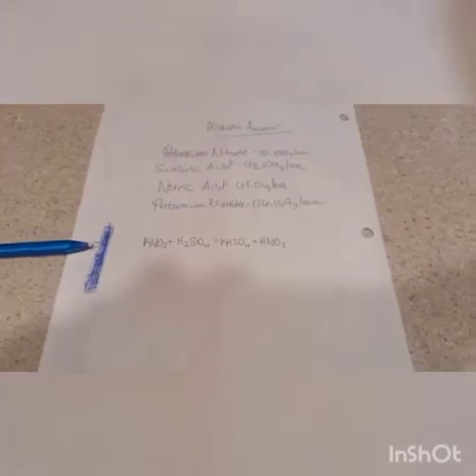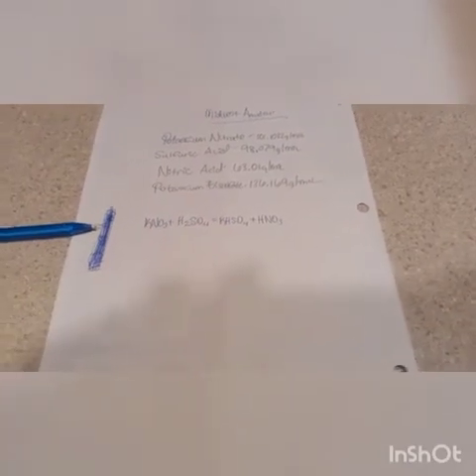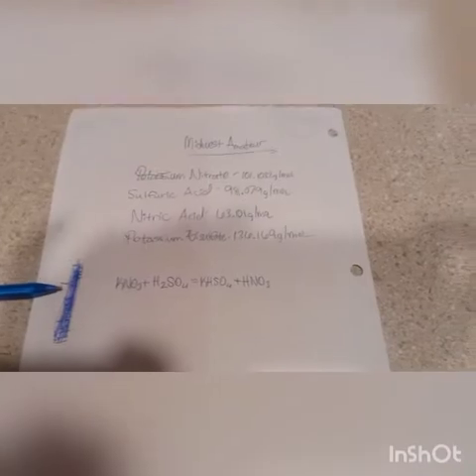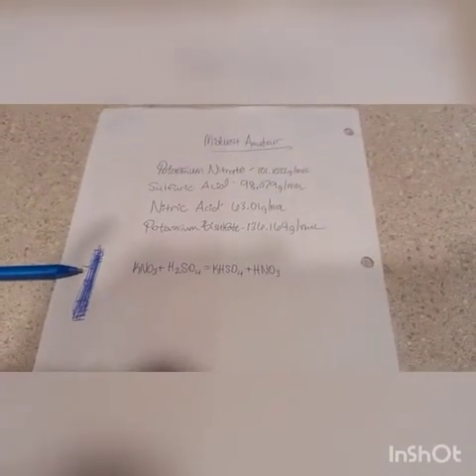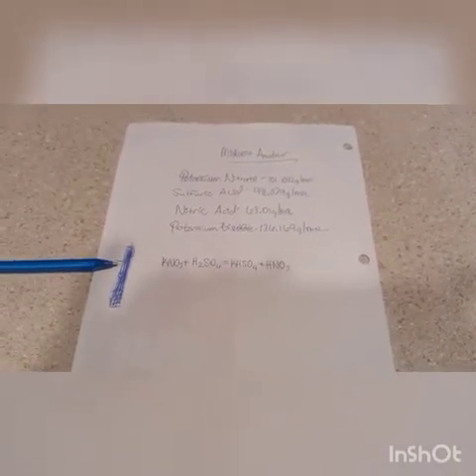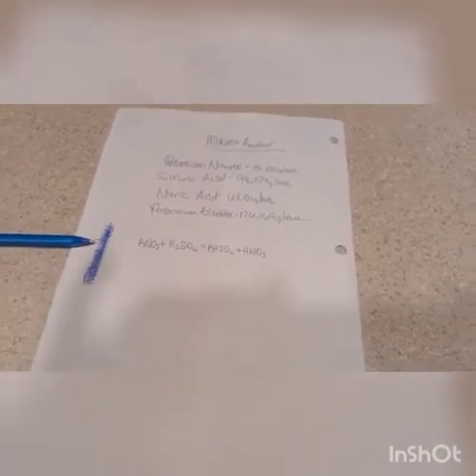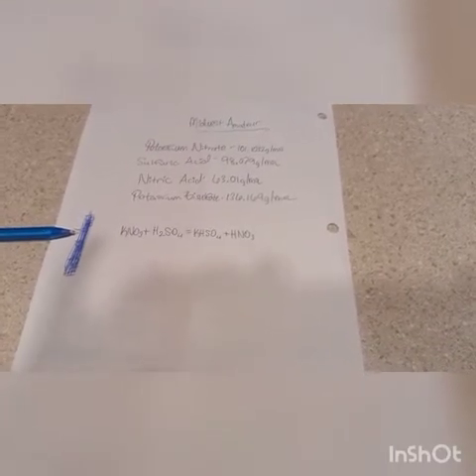So this is what we're using, and once you have your potassium nitrate loaded up, your sulfuric acid loaded up, you can put it together and start the heating. Nitrogen dioxide will be produced by the breakdown of this reaction. I would recommend, and I don't do it, but if you want the most for your money, start slow. Get the mixture to melt before you up the heat a little bit. You're going to break some down. Nitrogen dioxide is going to be produced pretty well no matter what. It's very difficult to not get out. So if you get the mixture to melt before you turn up the heat a whole lot, it will help. Usually I just go ahead and crank the heat up and I get a ton of nitrogen dioxide, kills my yield, blah blah blah blah.